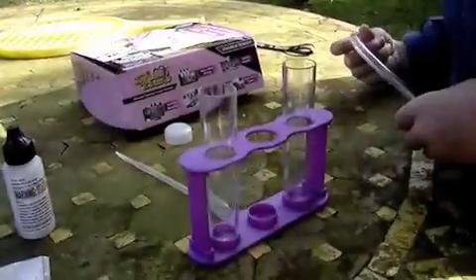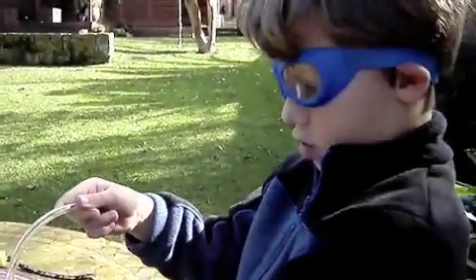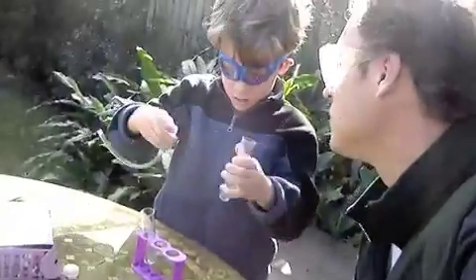Okay, and what are these? These are the test tubes. We'll be adding this tube into one. Each other one will have a lid on and one won't have a lid on. So we're going to put it like that — it's going to look like that during the experiment. Okay, so I'll take this lid off — just quite hard — so there we go.